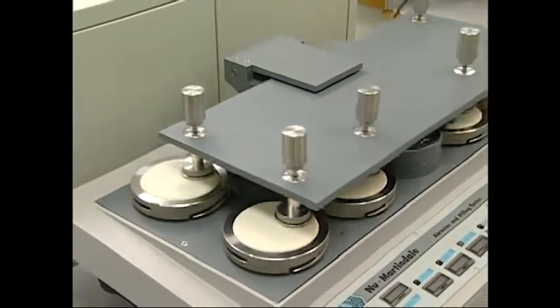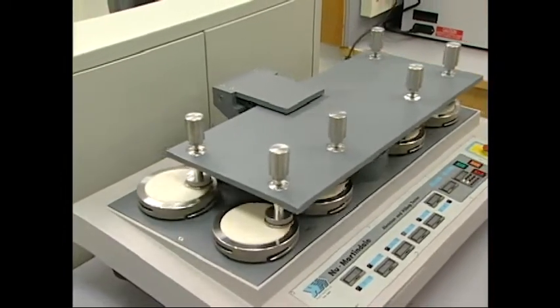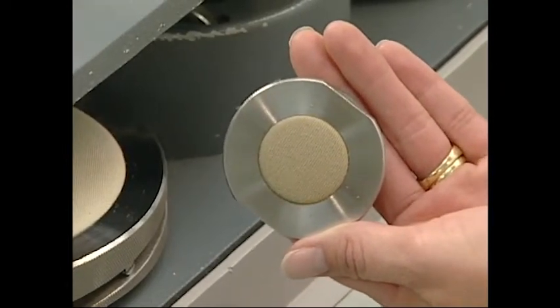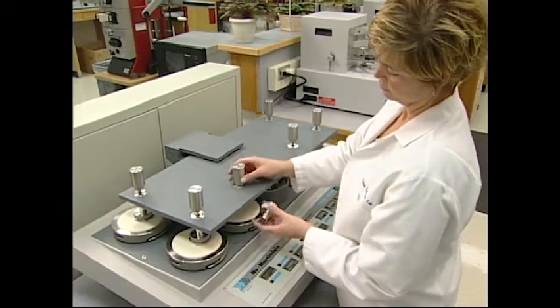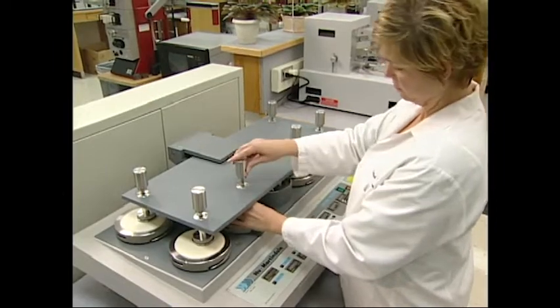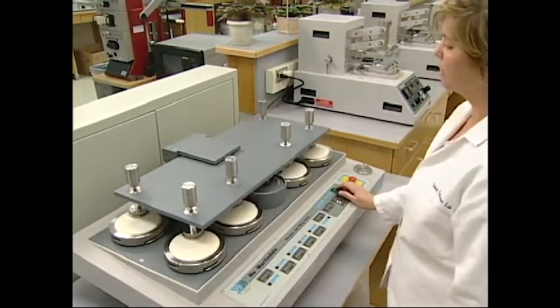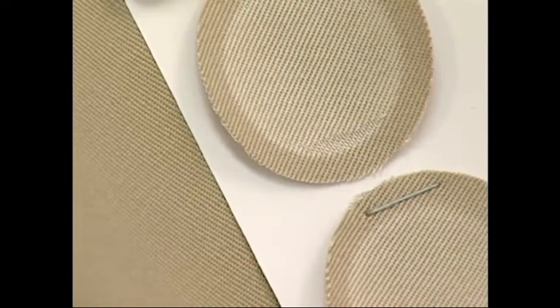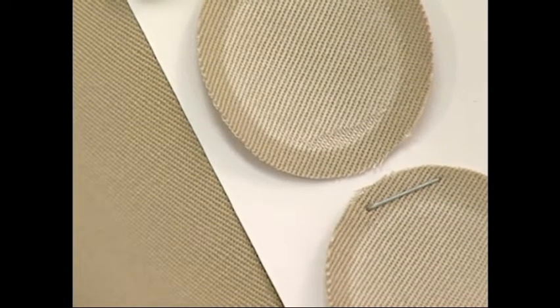If the specified endpoint is a complete rupture, then the tester is run for a specified number of cycles. The holder is removed and the specimen is evaluated for failure. It may also be compared to a non-abraded specimen. If failure has not occurred, the tester is restarted. If rupture is near, the test continues for a few more cycles and is evaluated again.